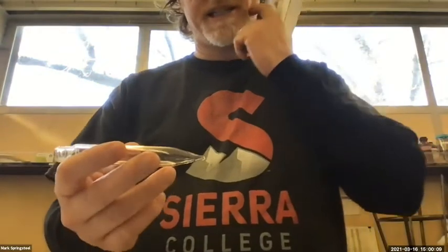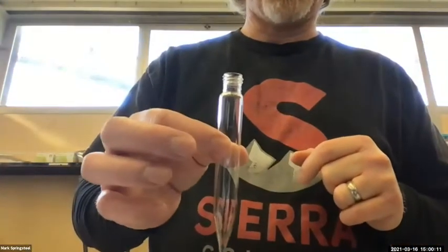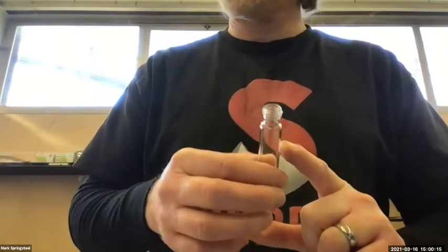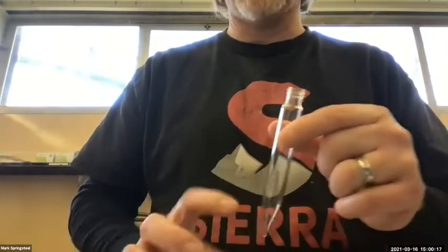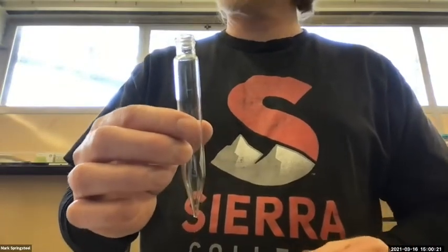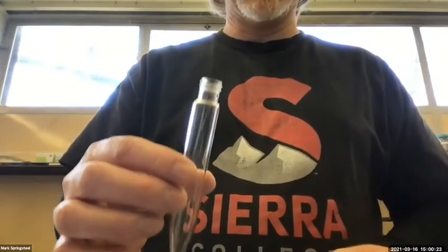For small scale extraction, centrifuge tubes are nice to use for the extraction. That's what I had in the diagram for the intro to this. It's kind of a shorter centrifuge tube. So we're going to use this. Since we're going to use a centrifuge tube, I want to make sure it doesn't leak.